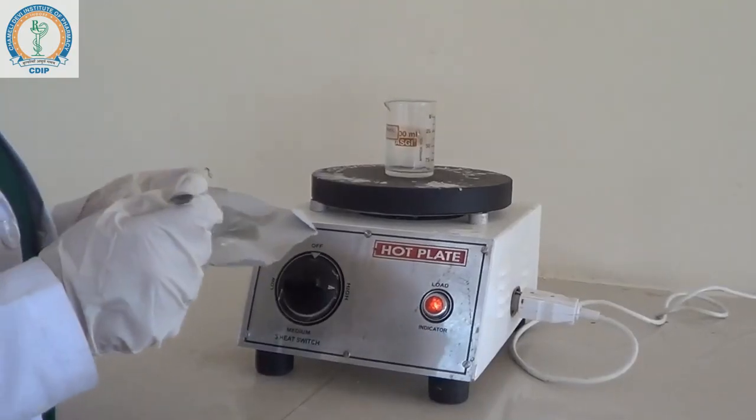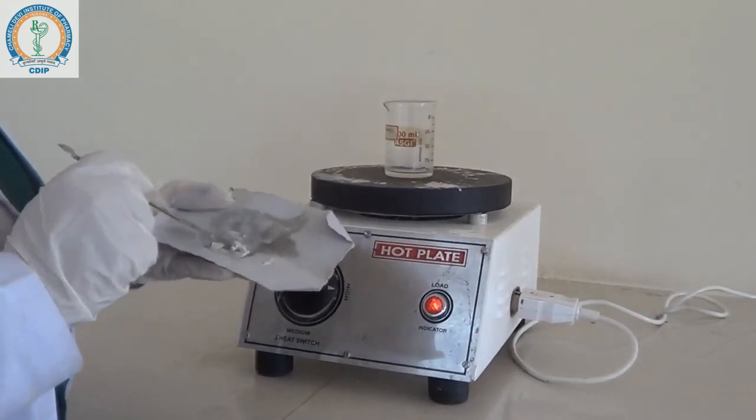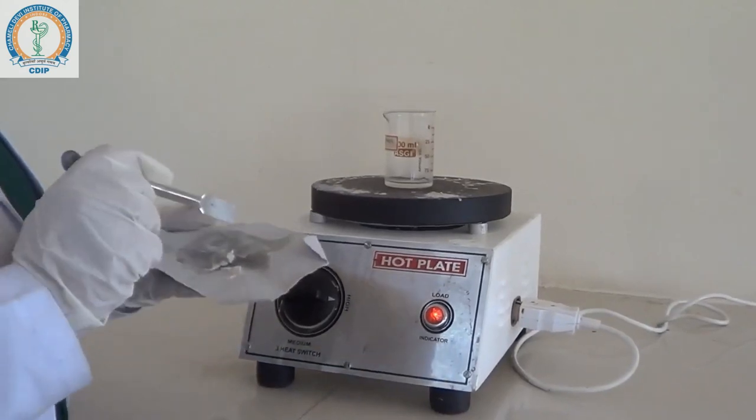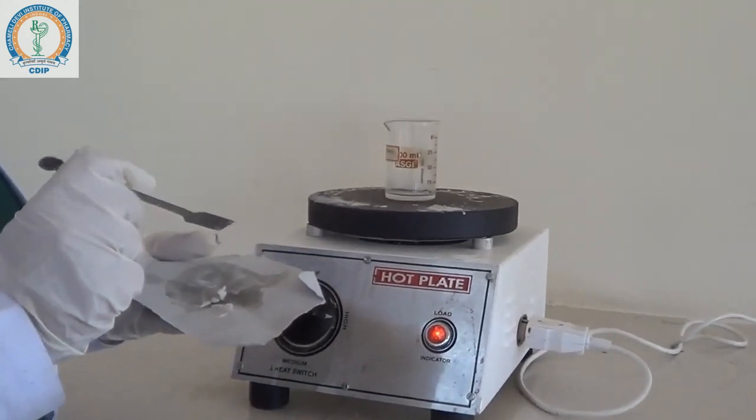Now we are going to recrystallize the crude benzocaine in the proportion, or we can say ratio, of ethanol and water, which is 2 is to 1.